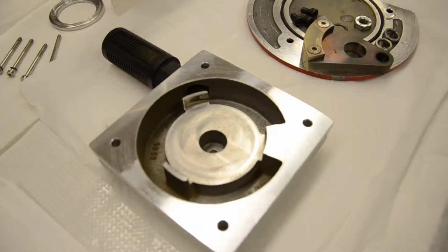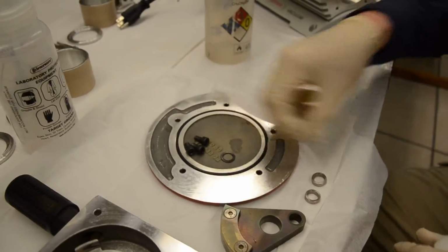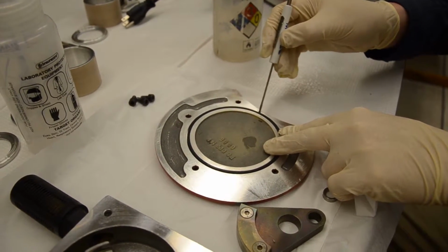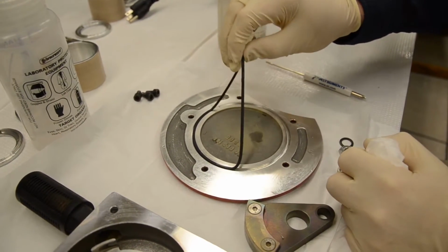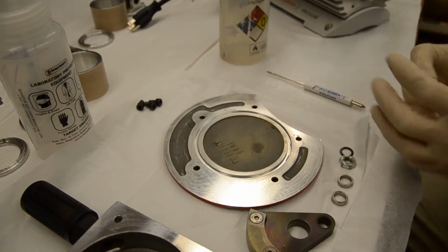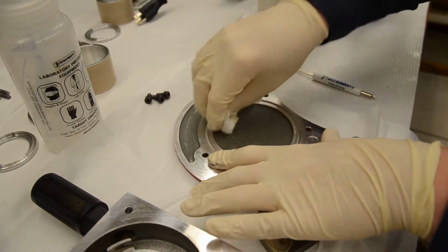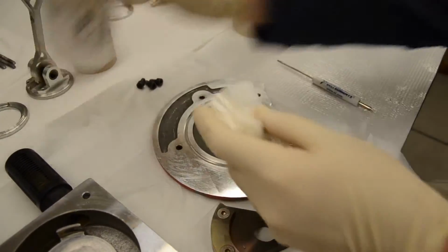The next piece, or pieces, that we're going to clean now are the internal assembly components and the face panel. So we'll start first with the face panel. Now you could use a screwdriver if you're really careful, or what works well sometimes is the end of a plastic wire tie. So we'll just remove that gasket. It will be replaced, or O-ring rather, will be replaced. So we're going to make sure that we clean this plate very well, as well as the O-ring groove.